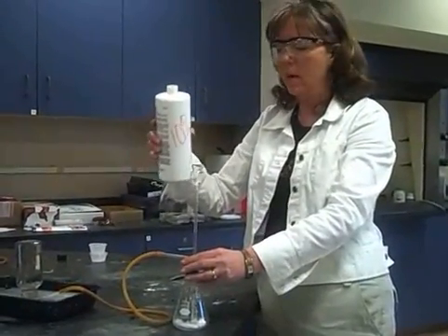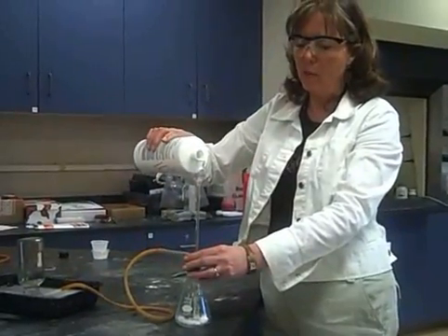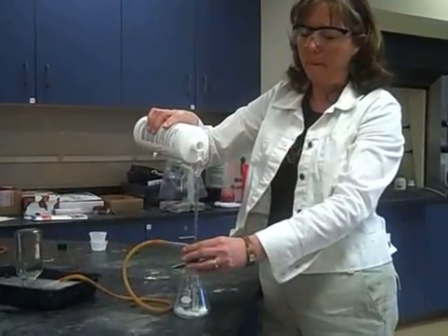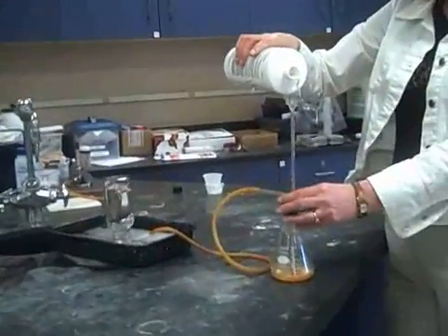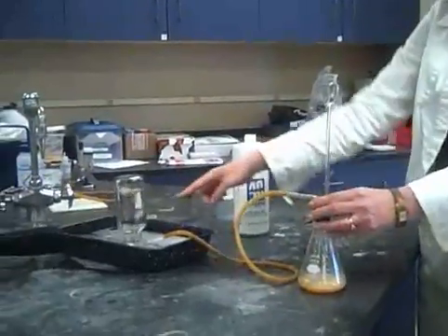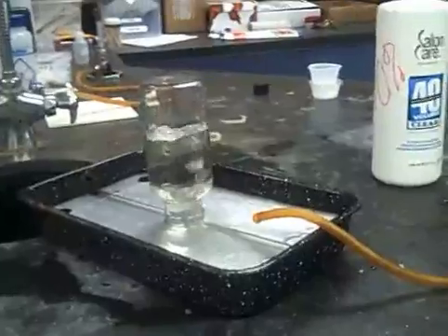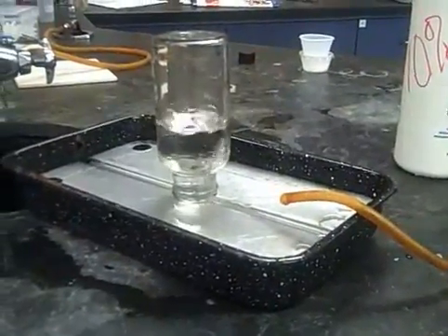Hydrogen peroxide breaks down with blood, with manganese dioxide, and also with KI. Watch what happens. I'm just going to add a little bit of that, and do you notice that it's bubbling right now into this flask? If it slows down, I'm going to add some more hydrogen peroxide, but right now it has a pretty nice steady flow.